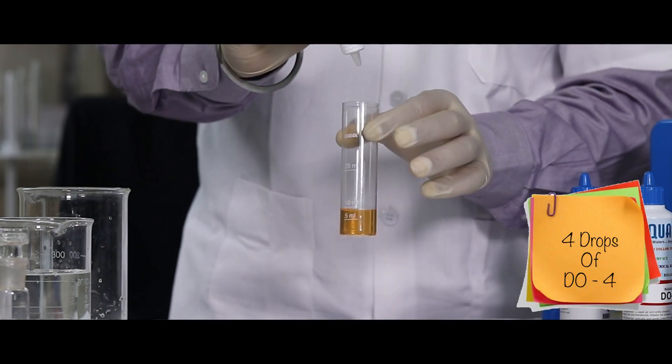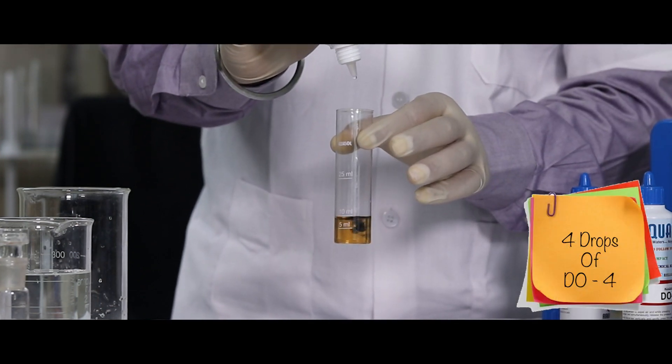Add 4 drops of DO4 reagent. Sample will turn blue in color.